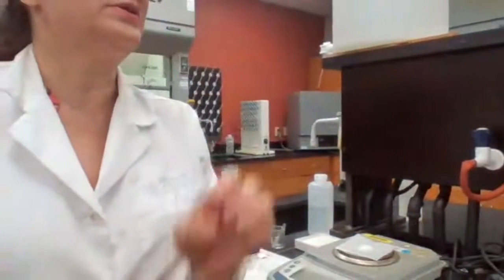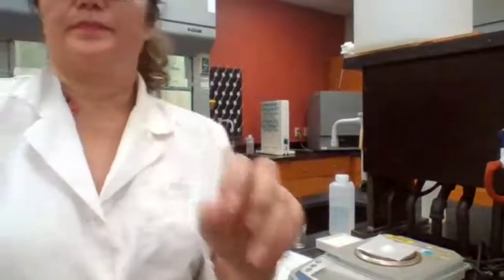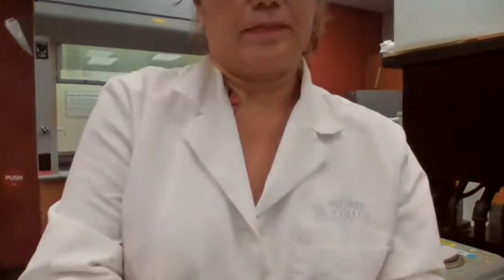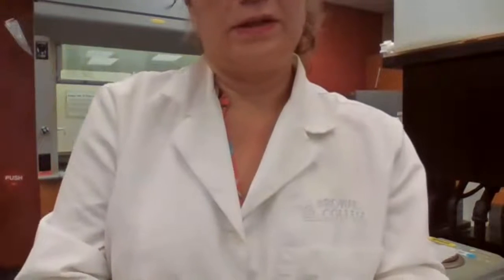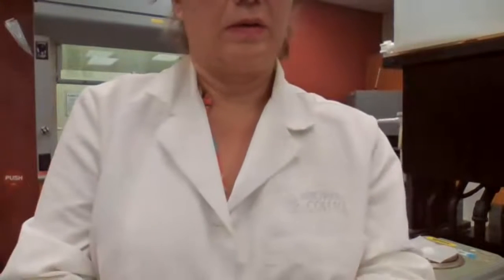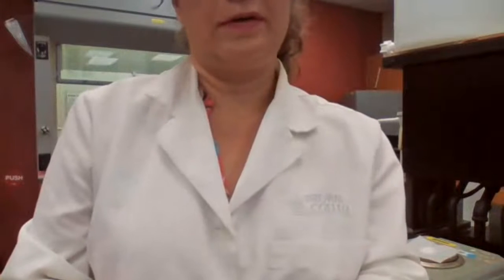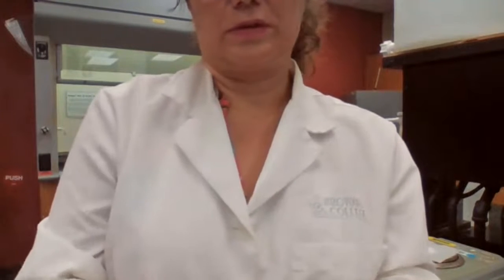This is for station 6. Station 6 is 3.351 gram salt.